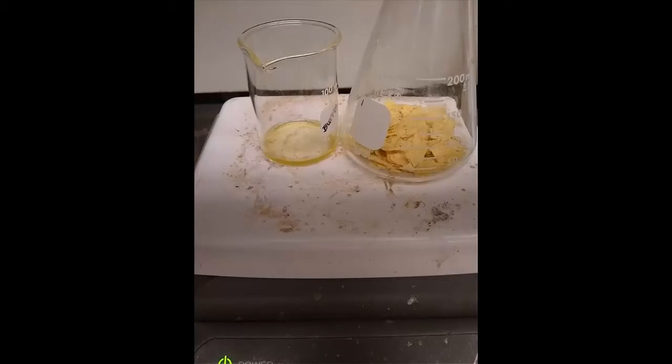At this point, after we had the plate at 130 for about 20 minutes, most of the ether had boiled away. We didn't want it to be too aggressive. We didn't want it to catch on fire, number one, and we didn't want any decomposition of the lipids in there either. There's a close-up look where you can see the ether is still there. That's essentially what is bubbling. The lipids at this low of a temperature wouldn't be boiling for the most part.